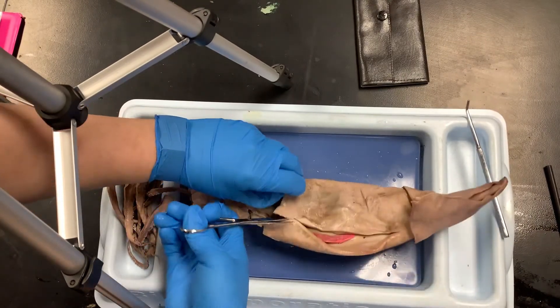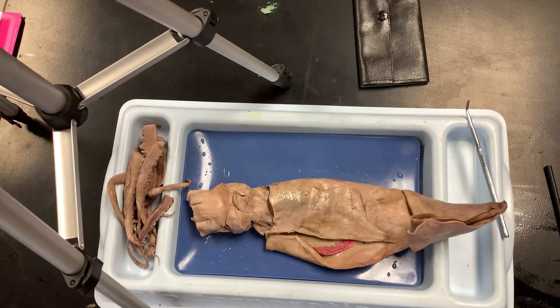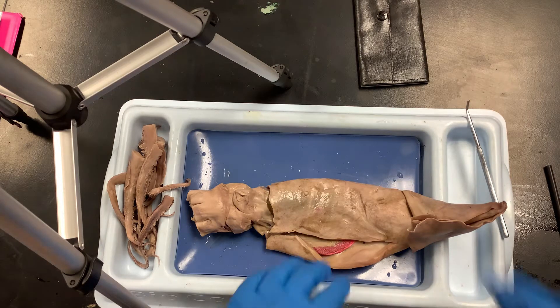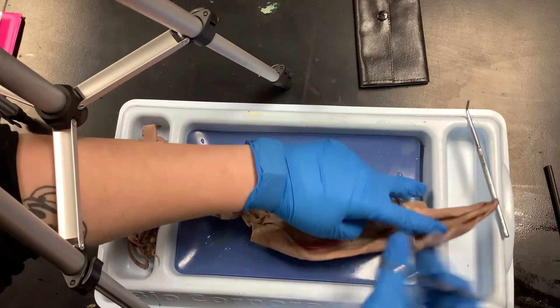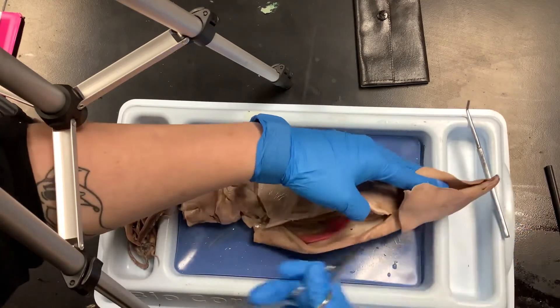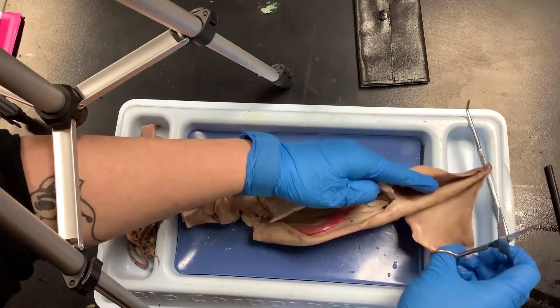The pink color is because these specimens have been injected — I paid a little extra so we could have injected ones. They inject them with a type of latex so that you can see where the blood is.